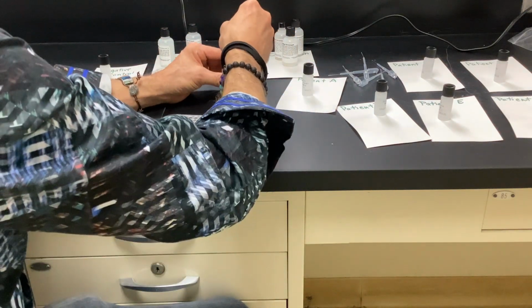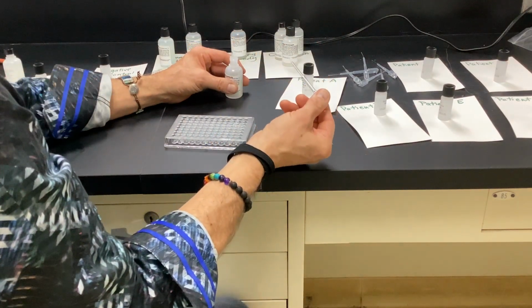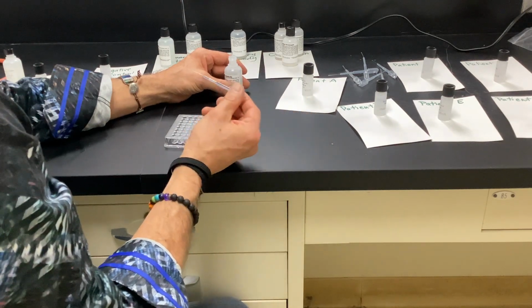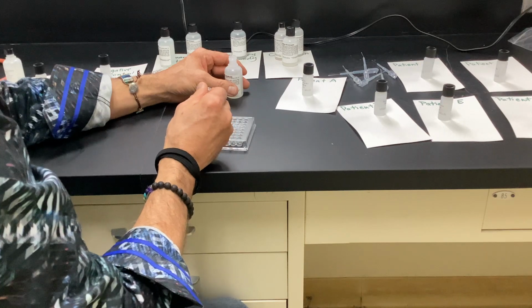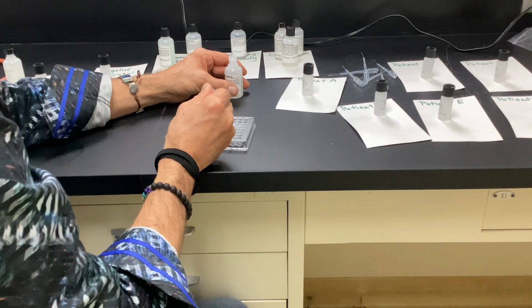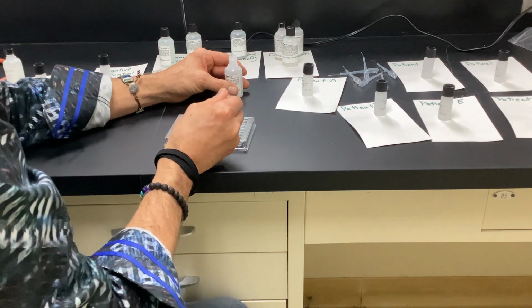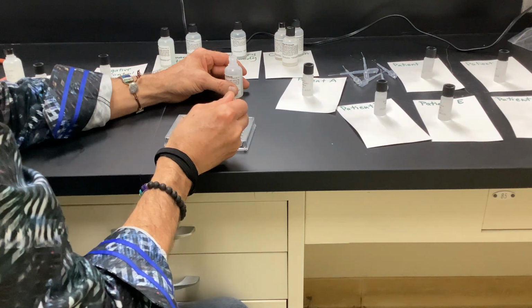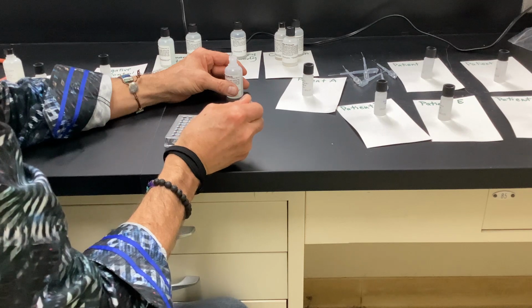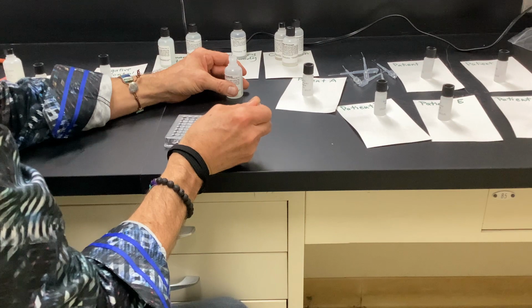So I have to do a secondary antibody to all of these. What's it saying? 3 drops to every single well, to each well of rows A and B. Yes. Don't let it touch the liquid that's in there. All right, so I'm doing the secondary to attach to the antigen-antibody reaction.